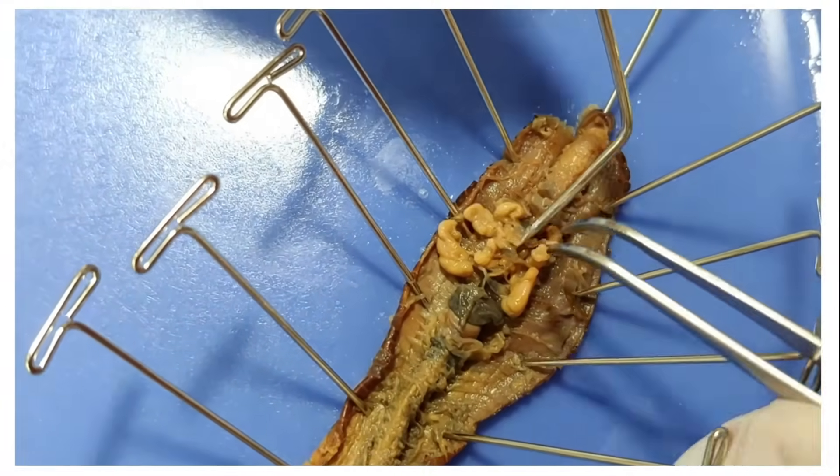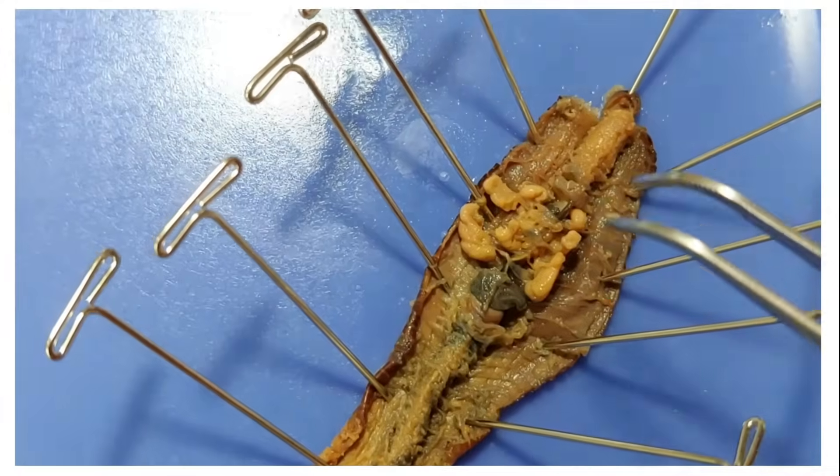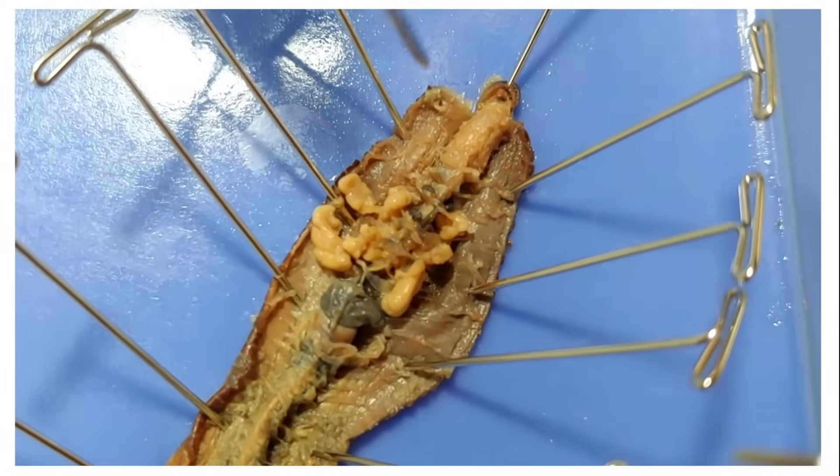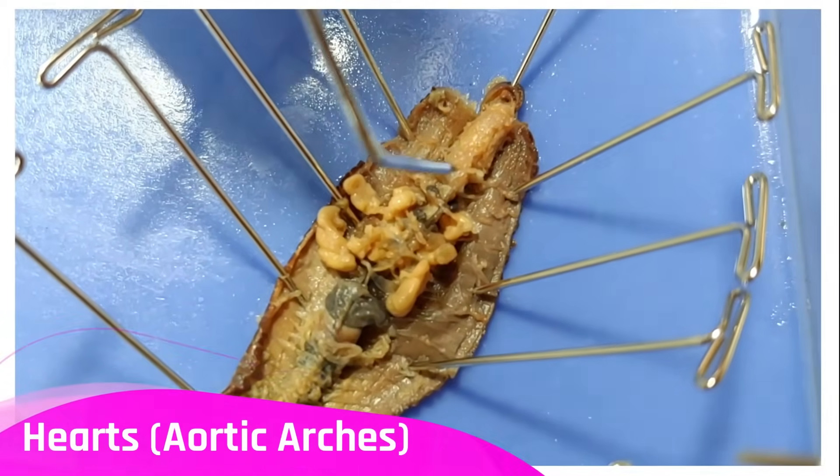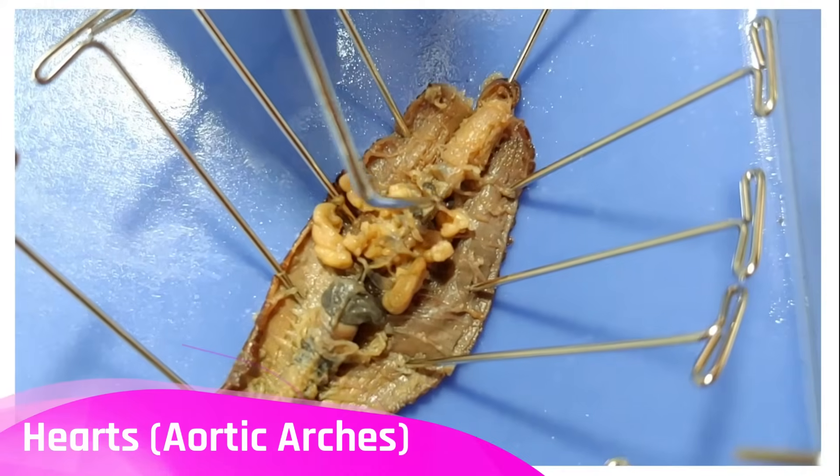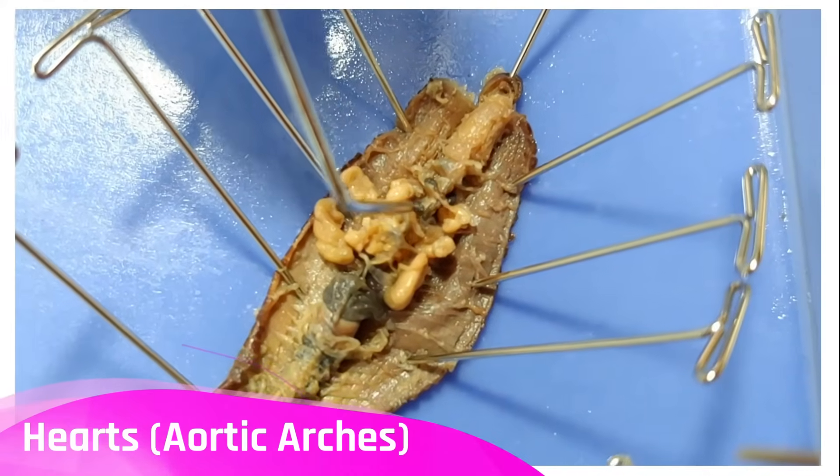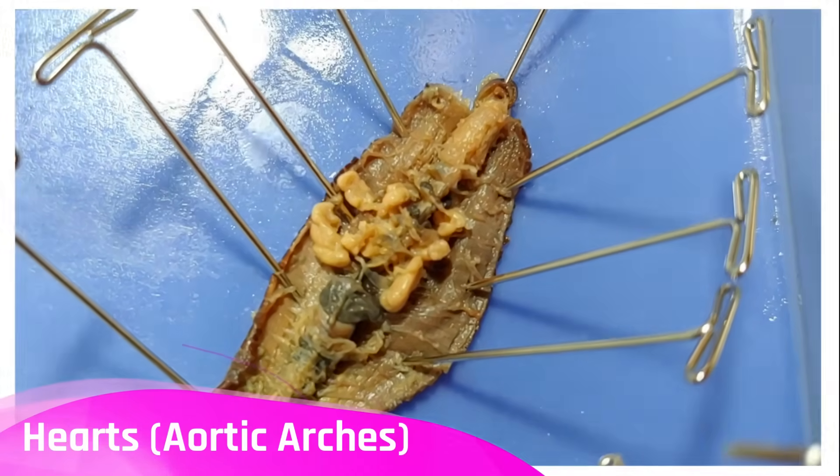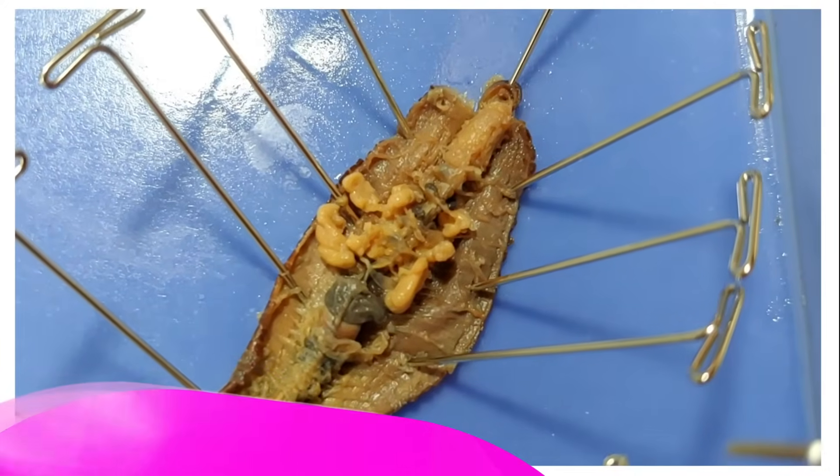So as I mentioned before, you have many things in common with a worm. For example, it has five hearts. These five hearts are called aortic arches and you can see them right here. I'm tracing them. They're basically fancy versions of regular blood vessels that pump blood.